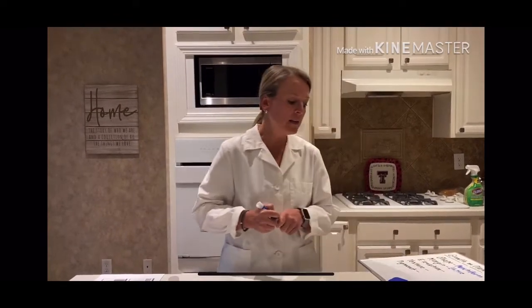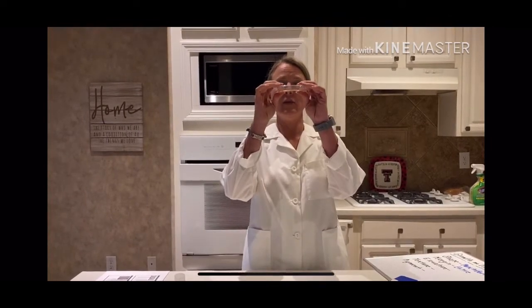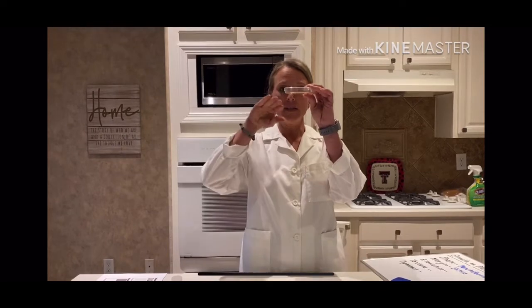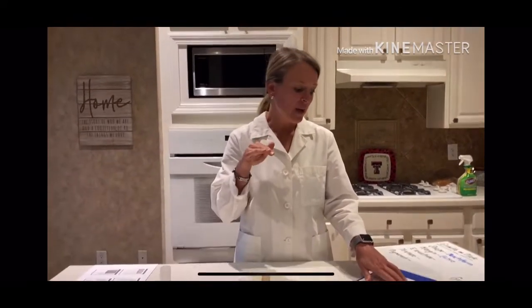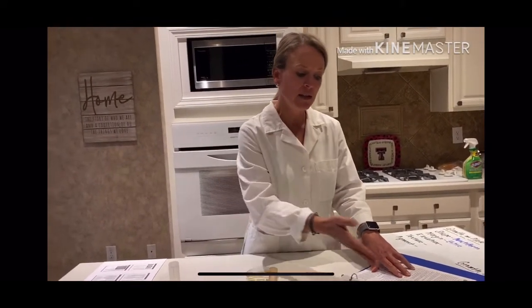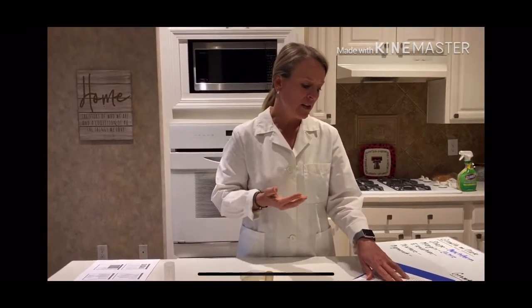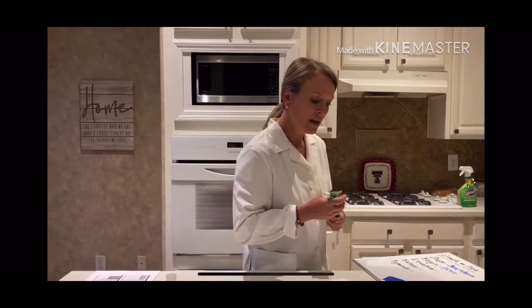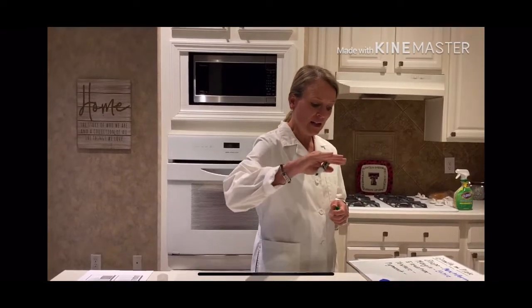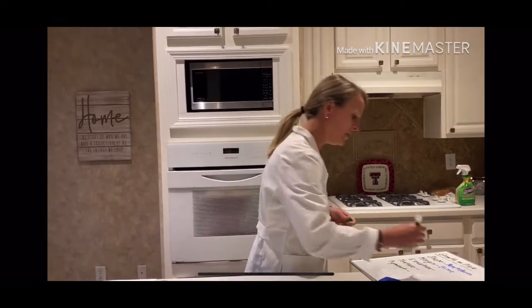Now, for the elevation, I want to take a look at the organism from this angle and see, is it raised up off the surface of the plate, or is it very flat? It can be flat, it can be raised, it can be convex, and again, using the descriptions along with the images in your lab manual, you're just going to describe what the elevation looks like, okay? On mine, I'm going to go with it being convex, meaning that it's not completely raised, but it raises up and curves over a little bit.